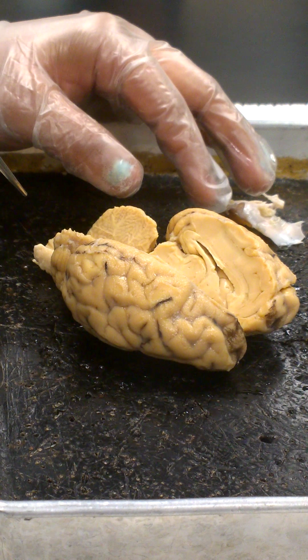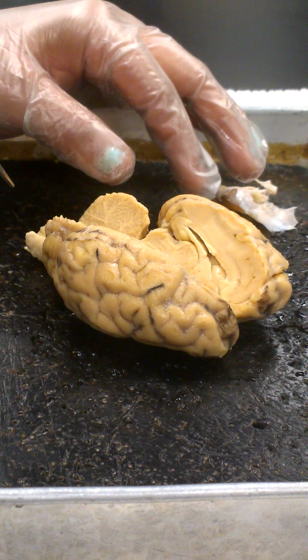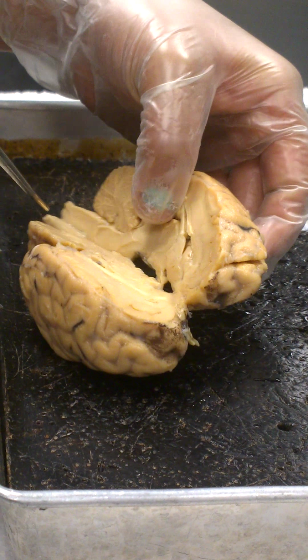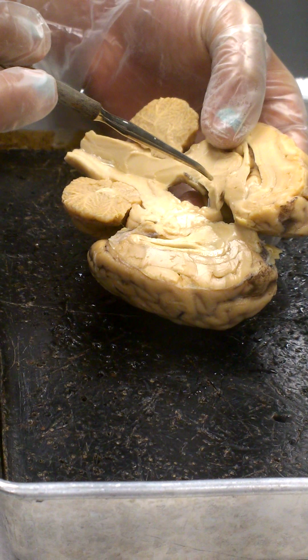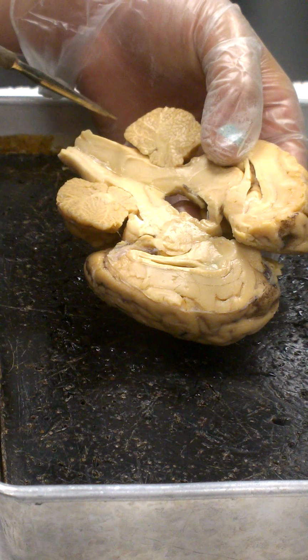The mammillary body is a structure which we can see from the outside as well. I'll go back and show you that on the outside view, but we can see it internally here as a structure that's been sectioned in half right there. When we review through the cranial nerves on the outside, I'll show you again where it is on the outside, and we can compare that location to this inside location for the mammillary body.